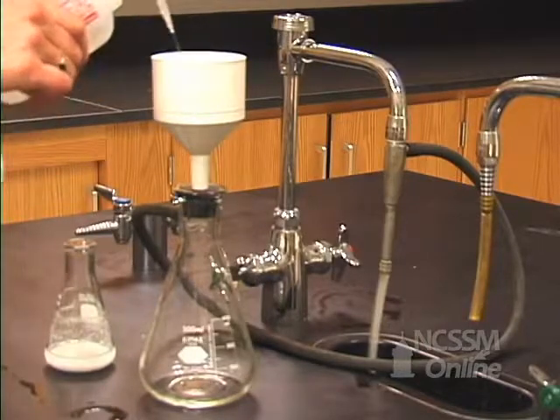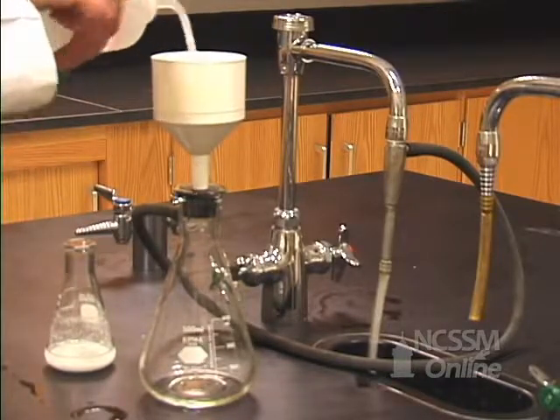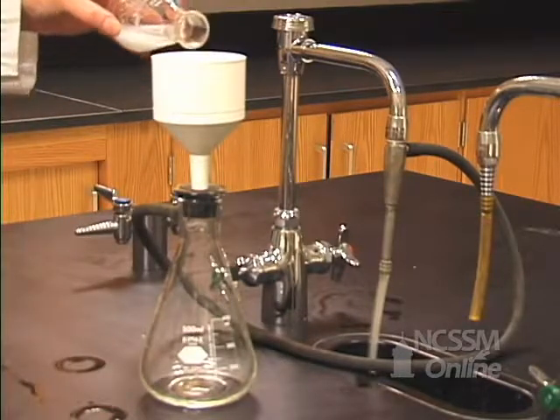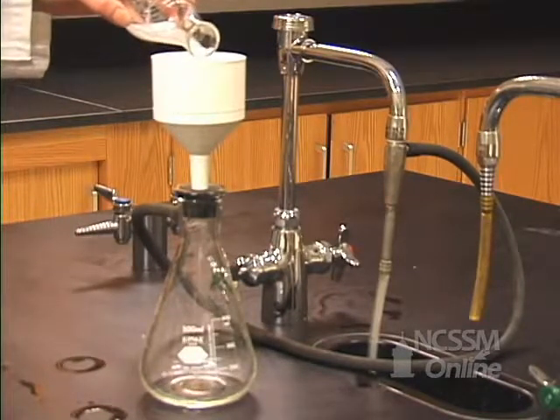We use just a little bit of water to make a nice tight seal, and then we'll pour our aspirin solution into the funnel.